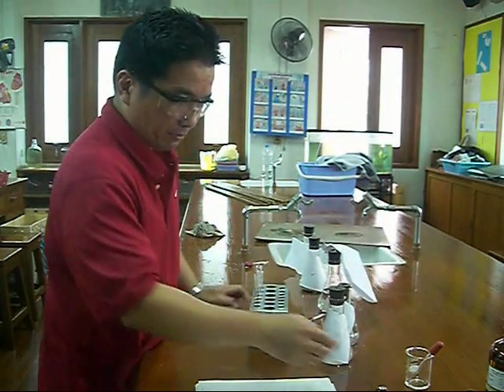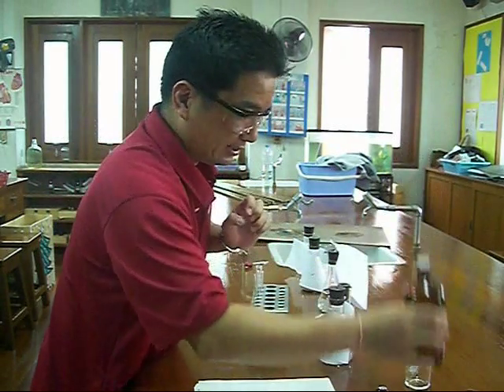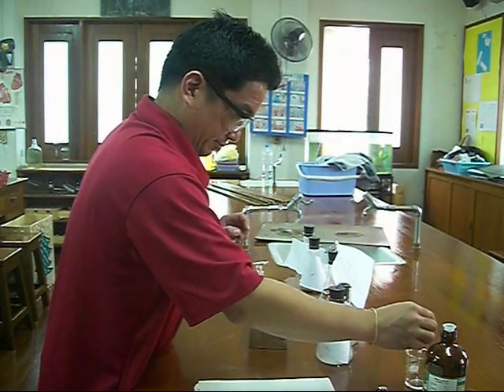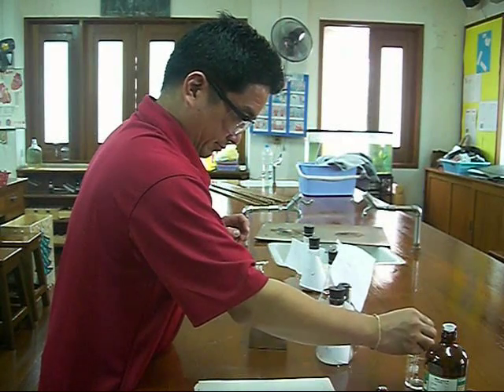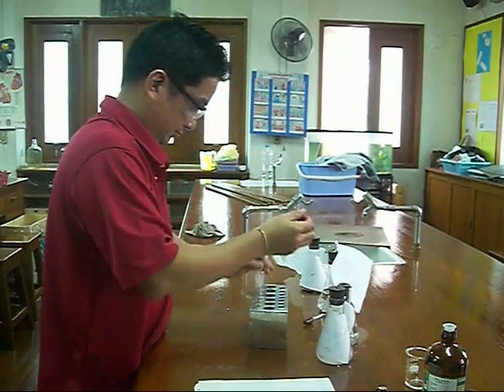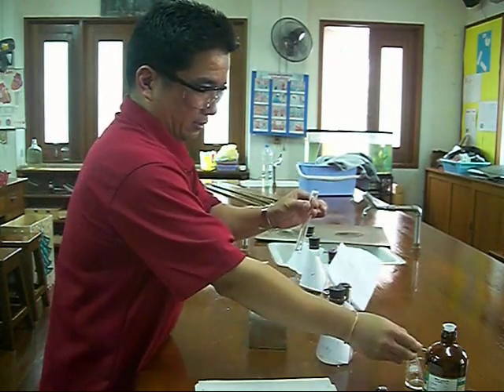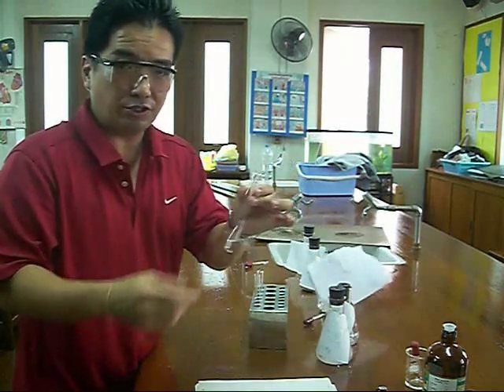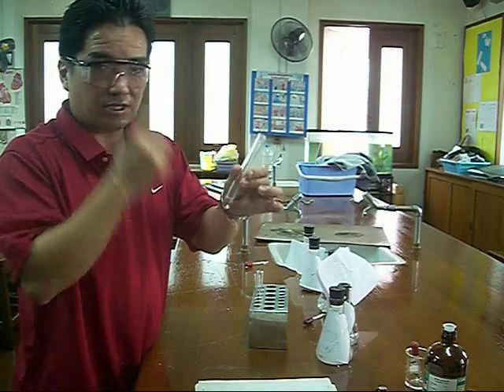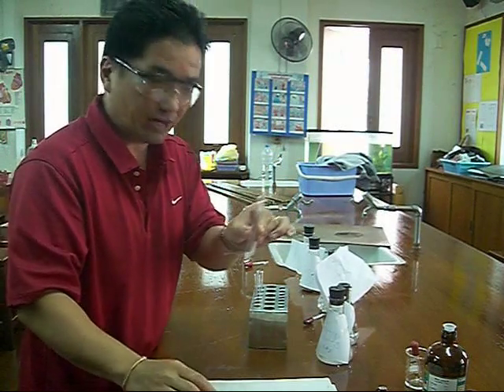To that we add nitric acid. Please note when you're using the test tube with acids, you want to have goggles on and do not point the container at anyone.